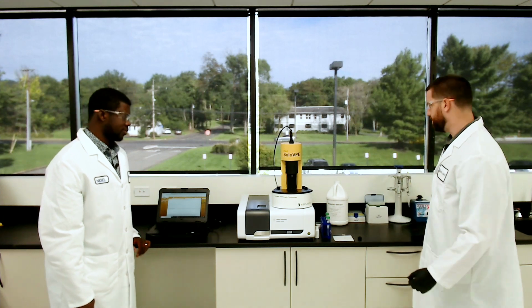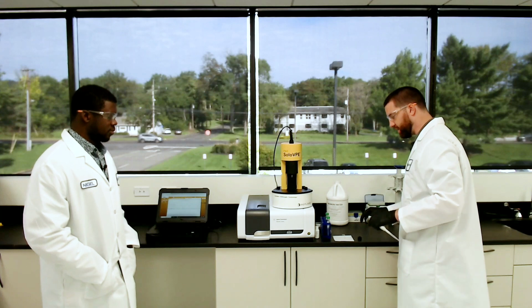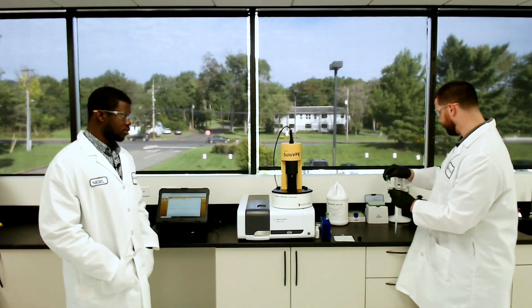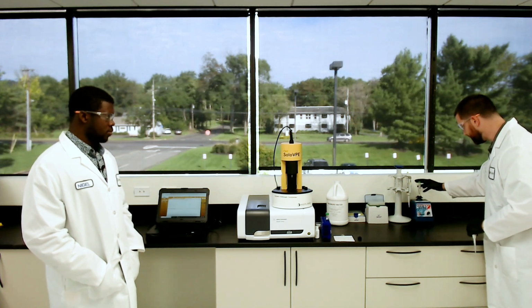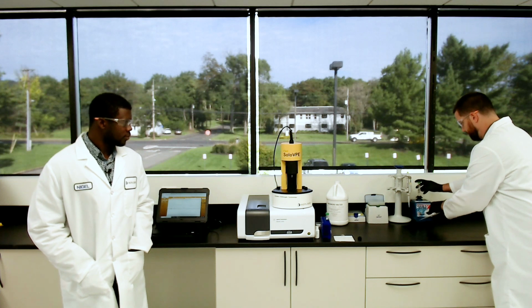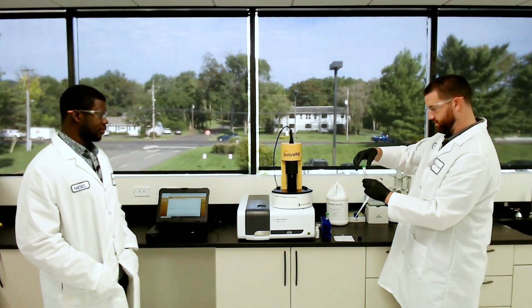Thanks, Nigel. All right, I'm going to prep the BSA. We're going to use a large vessel since we're using a low concentration. I got my BSA here. Just give it a quick vortex and a couple inversions. Always want to make sure everything's mixed properly. Definitely.